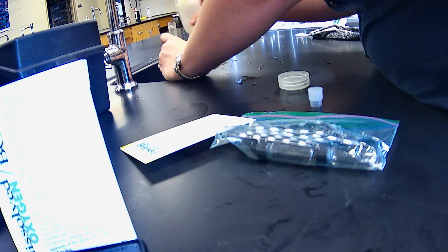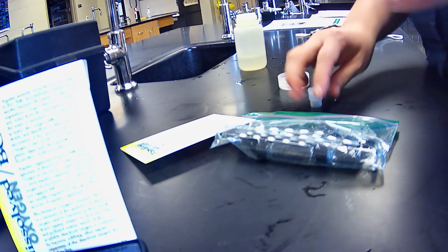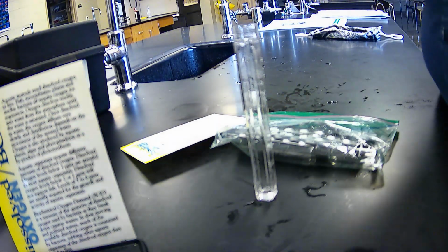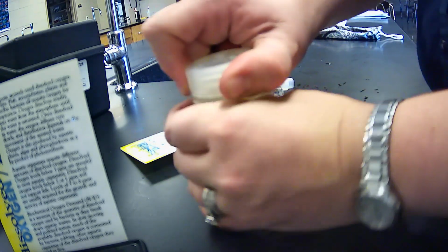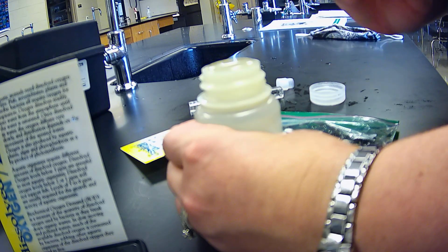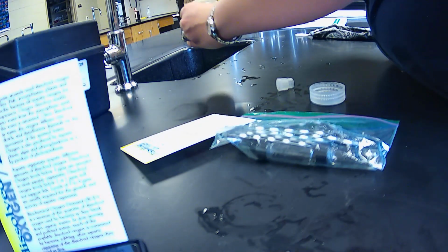So I'm rinsing the sample with water we got from the creek, again, to try to keep our sample valid. But this one has already had a lot of oxygen in it, so I'm going to use this tube that I filled up properly. If you notice, it has no air bubbles, right? It was even capped underneath the water. So this is a good sample. See how it's got that meniscus there, right? So that's really, really good. And so I'm just going to try to fill this as much as I can.